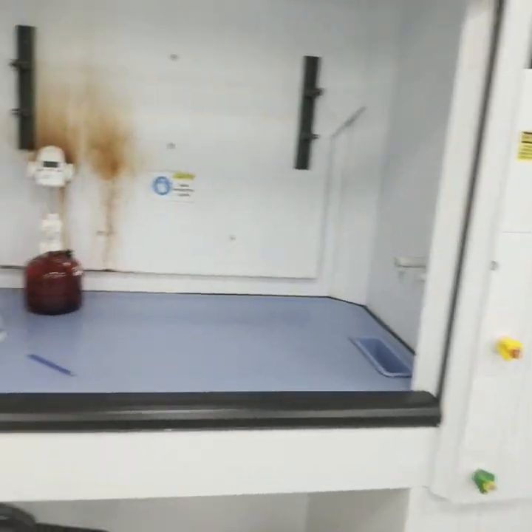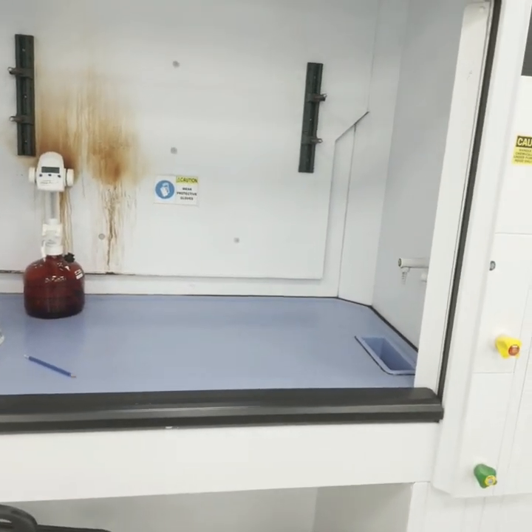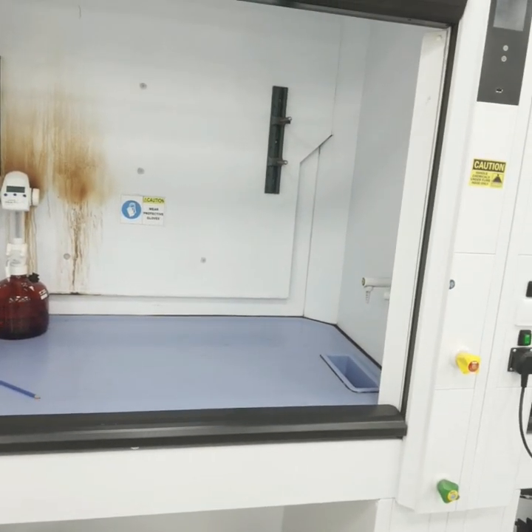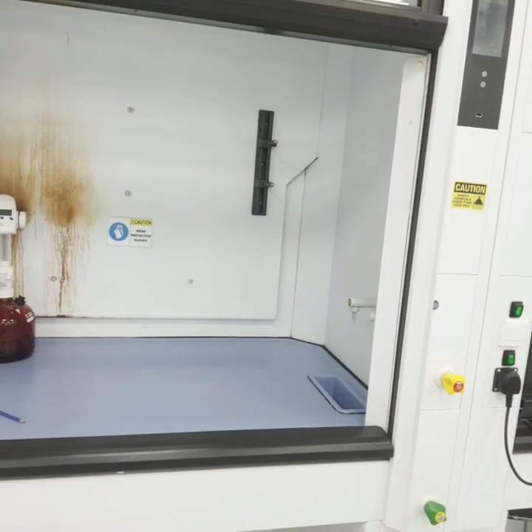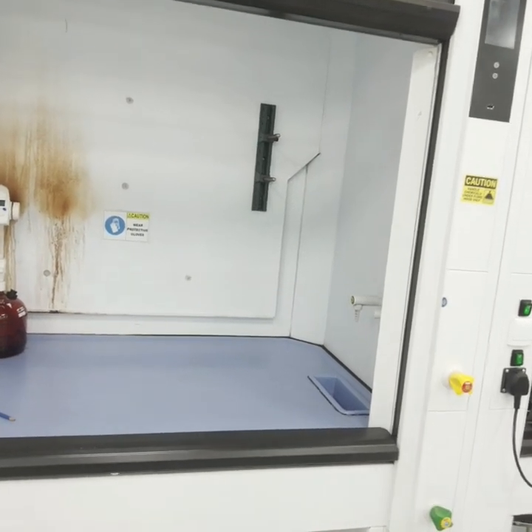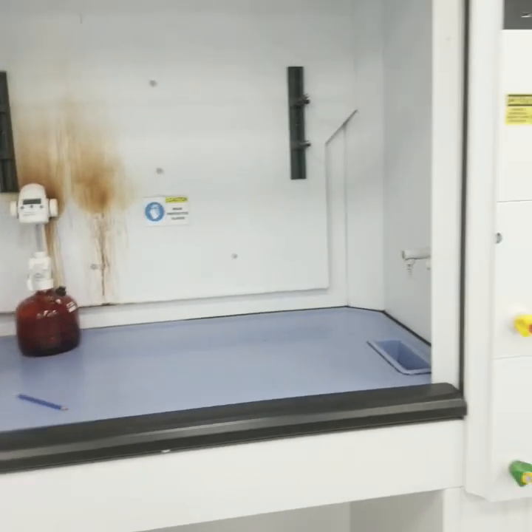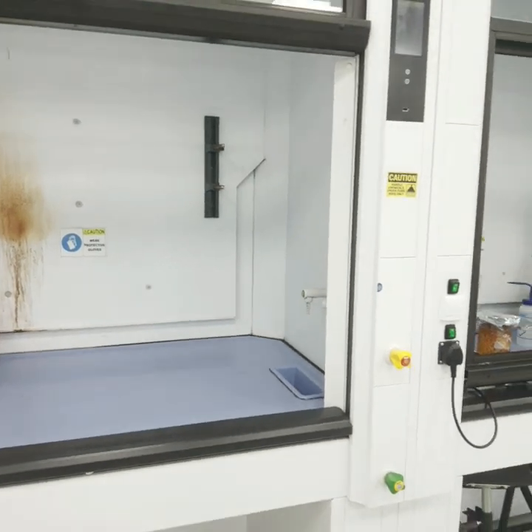It is important to note that biosafety cabinets have HEPA filters, while chemical fume hoods do not.